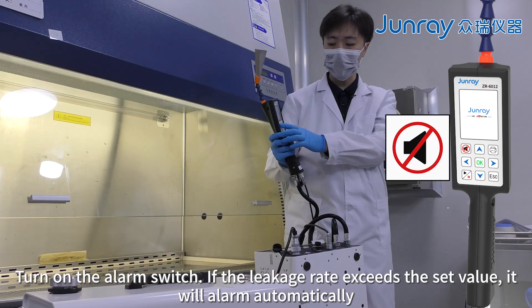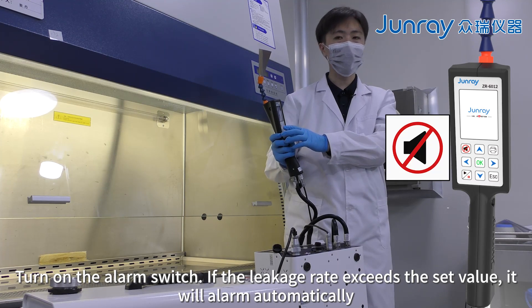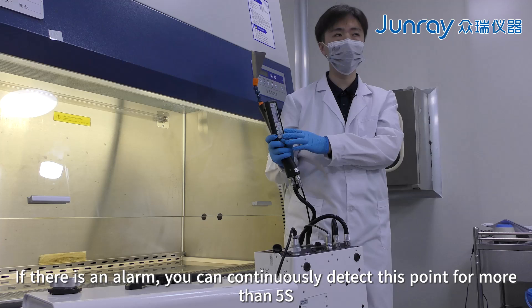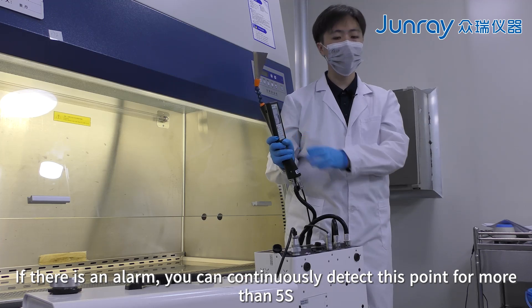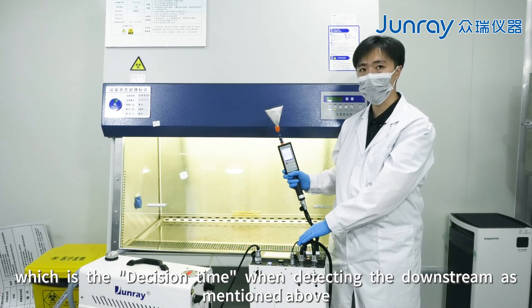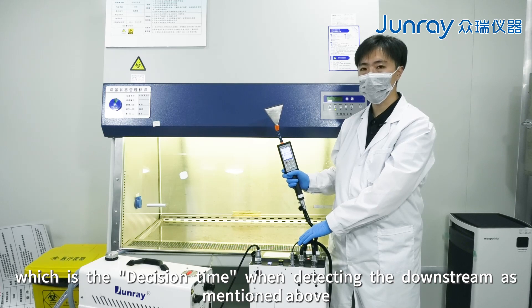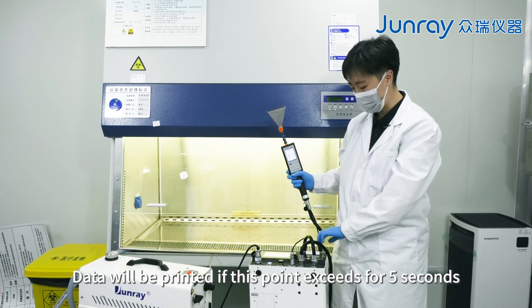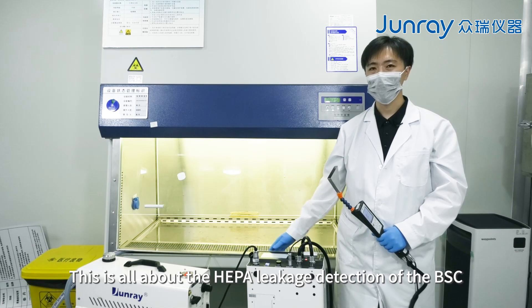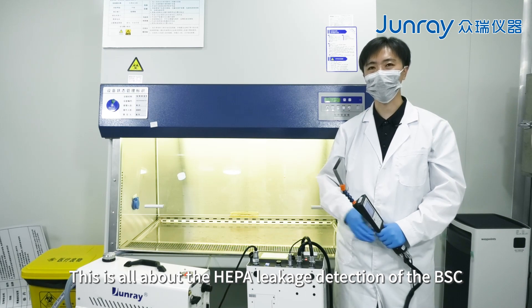Turn on the alarm switch. If the leakage rate exceeds the set value, it will alarm automatically. If there is an alarm, continuously detect that point for more than 5 seconds — this is the decision time mentioned above for downstream detection. Data will be printed if the leakage at that point exceeds 5 seconds. This is all about the HEPA leakage detection of the biosafety cabinet. Thank you.